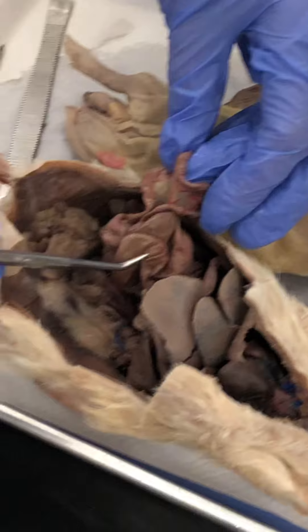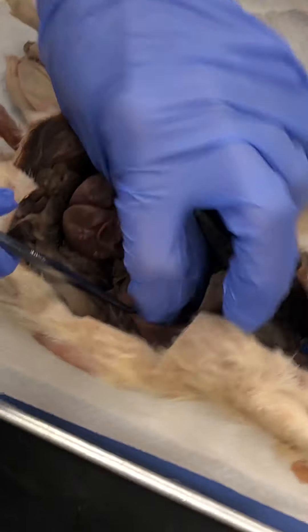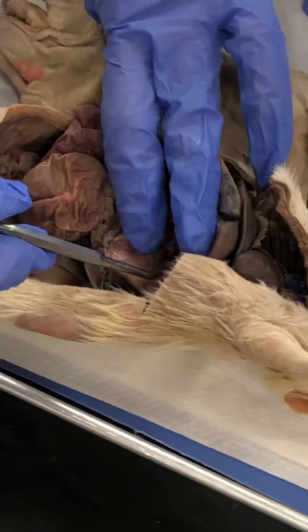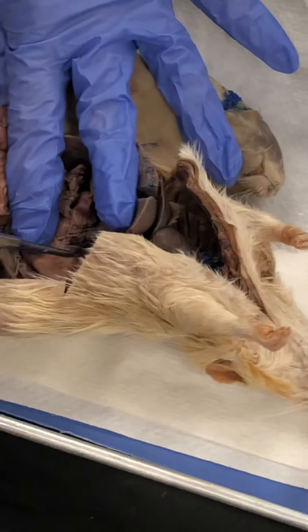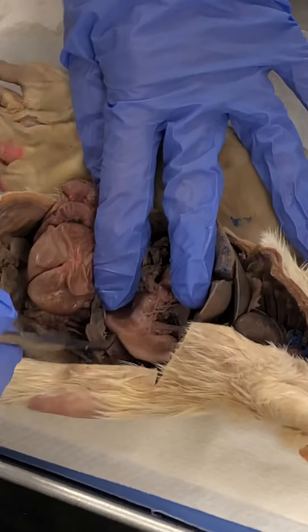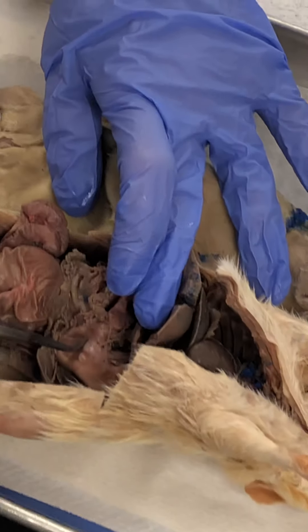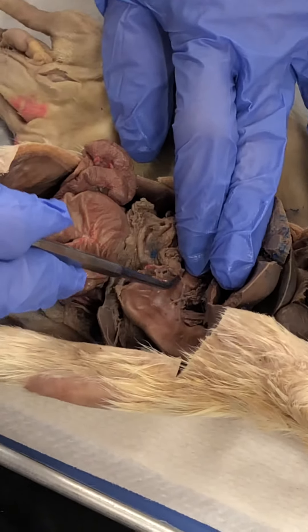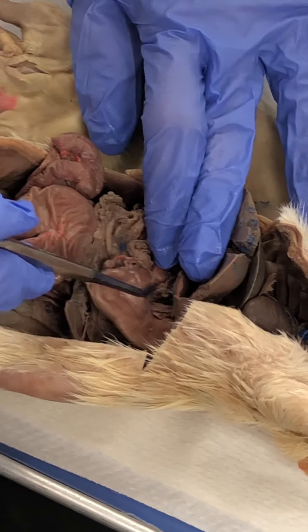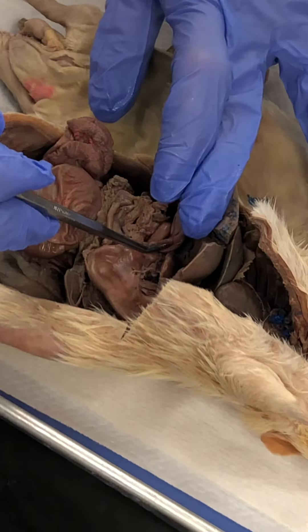Now we look at the digestive system. The tube going into the stomach is the esophagus. This is the stomach — the top part is the fundus and the bottom part is the pylorus. Where it pinches right here is the pyloric sphincter or pyloric valve. This is the first part of the small intestine, which is the duodenum.